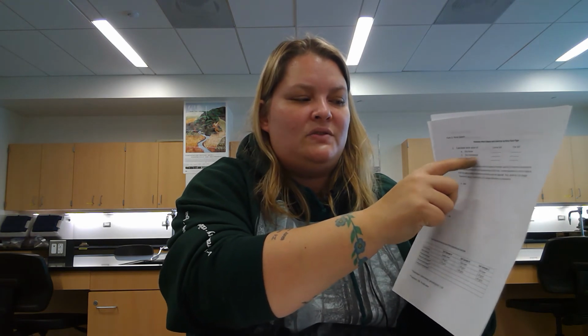So you'll see, to figure out percent pore space, you need to know bulk density and also your specific gravity, which is particle density. So once you figure out your bulk density of your dry loose soil, your dry compacted soil, and then your good tilth soil, you'll be able to plug that into the equation. It assumes that the particle density is 2.65.